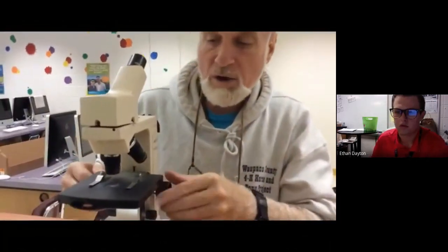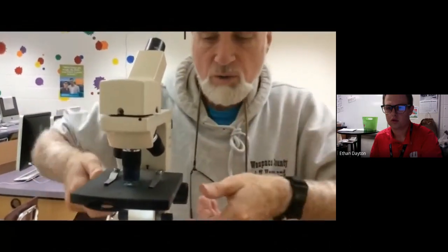Now, if your teacher says we are working in high power now, so I'm going to move it to high power. And now it's time to clean up. We cannot touch coarse adjustment because it's in high power. If we did, we could ram the stage up into the lens and cause major problems. So whenever we're in high power, we're always working with the fine adjustment, the smaller knob.